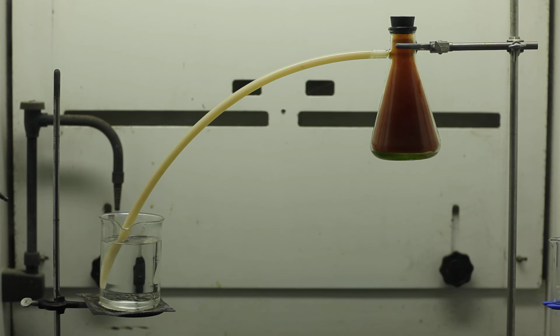I tried to get rid of the objectionable mess by picking it up and throwing it out the window, which I had meanwhile opened. I learned another fact. Nitric acid not only acts upon copper, but it acts upon fingers. The pain led to another unpremeditated experiment. I drew my fingers across my trousers, and another fact was discovered. Nitric acid acts upon trousers. Taking everything into consideration, that was the most impressive experiment, and relatively probably the most costly experiment I have ever performed."